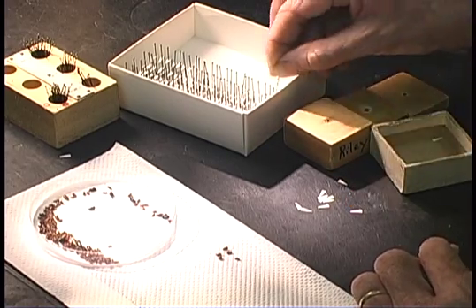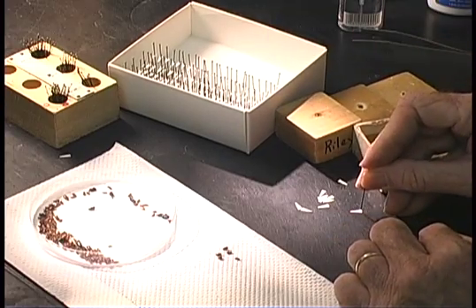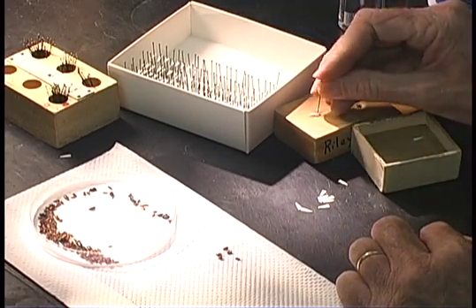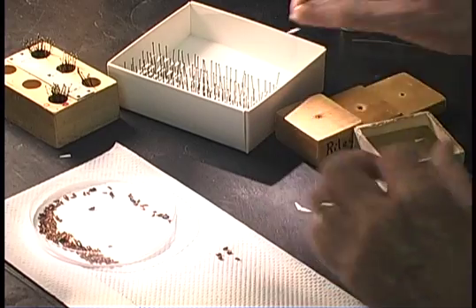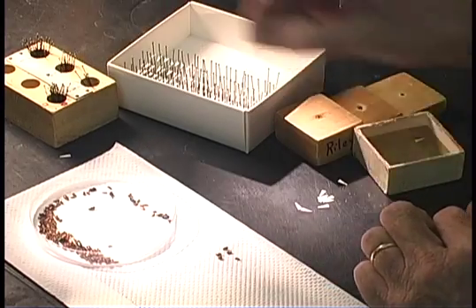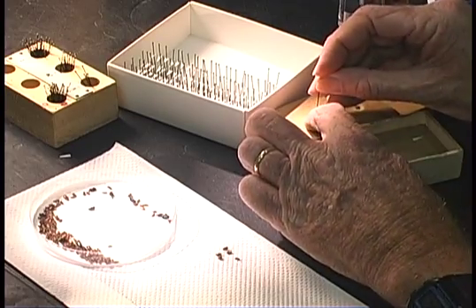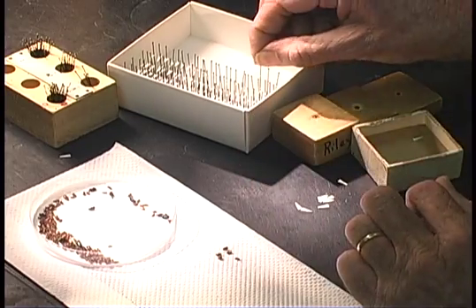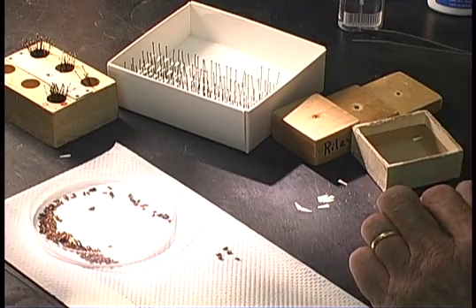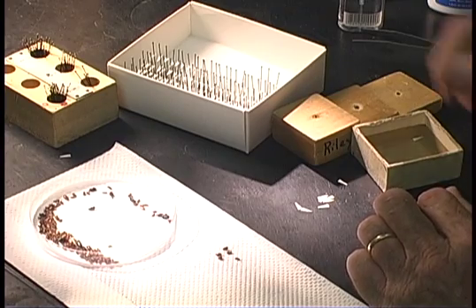Most pinning blocks, you would use the uppermost level of the pinning block as your height for the points. That helps give you a nice standard uniform appearance to your collection and gives you nice uniform specimens. That helps in keeping the specimens safe when you are handling them.